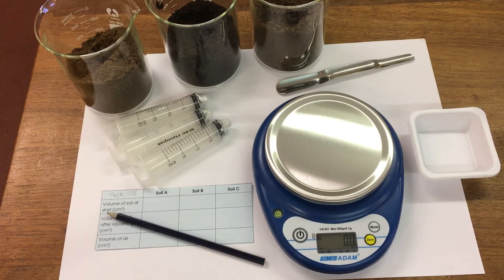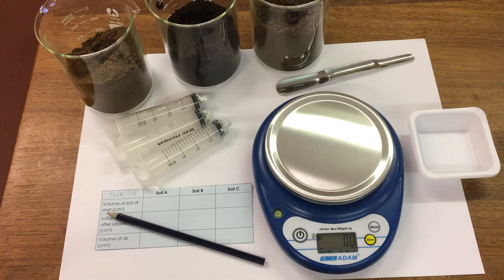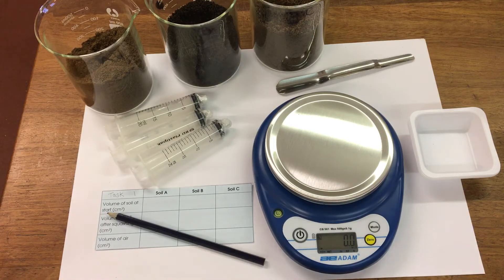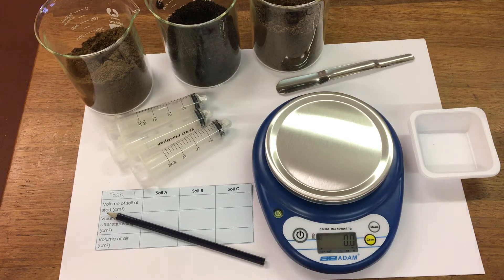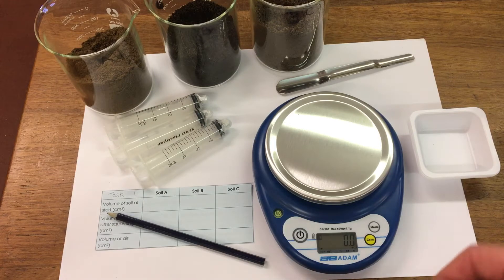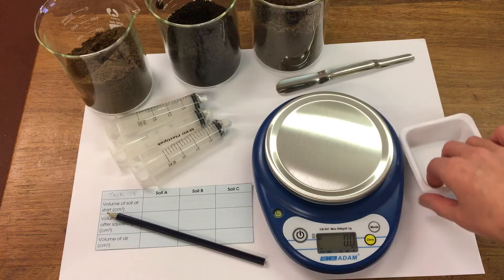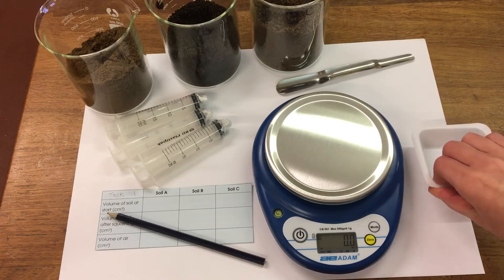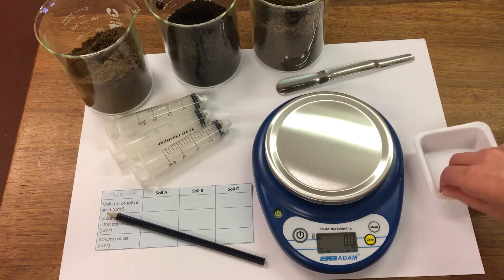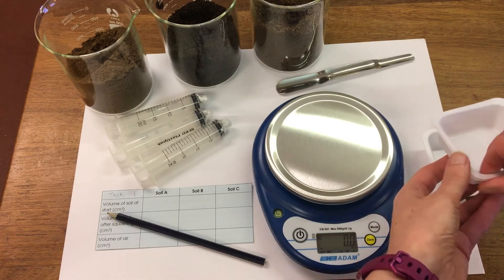The first task — task 1 — we're going to compare the volume of air in each soil. First of all I'm going to measure out 10 grams of soil and add it to our syringe.